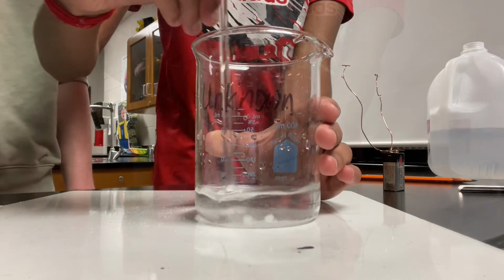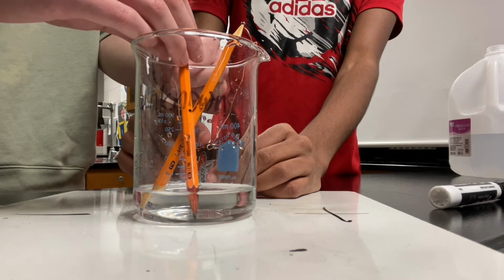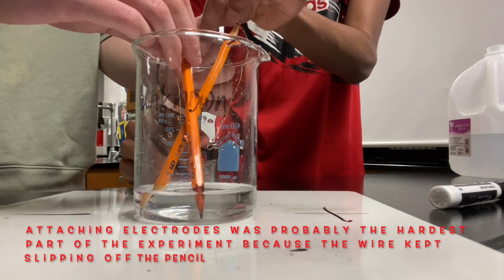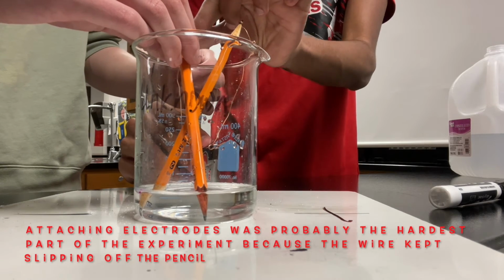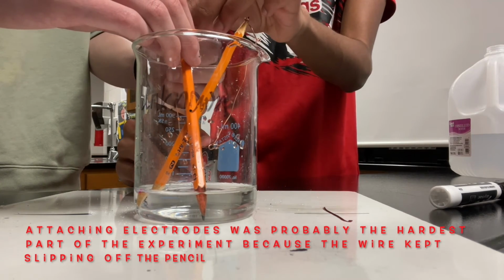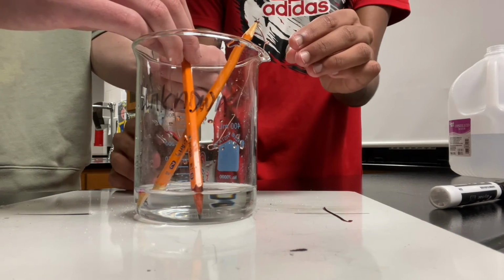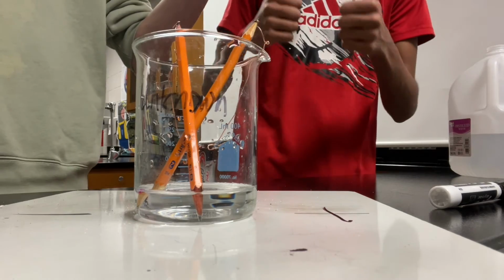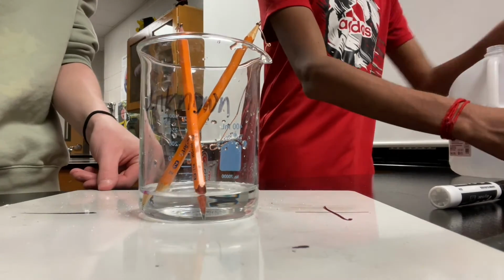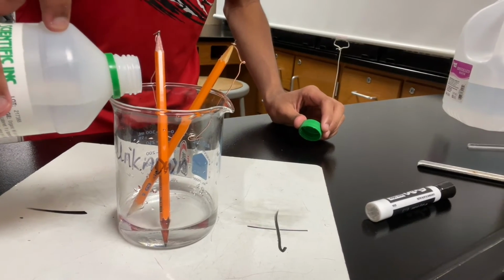When fully dissolved, we will attach the pencil apparatus to the copper wire so that the battery is connected to each graphite electrode. We have to ensure that the copper wire and the graphite are directly touching. Simply because it was easier when constructing, the pencils are crossed so the reactions shown before in the diagram occur at the opposite side. We will then add some color indicator phenolphthalein to the solution in the beaker.